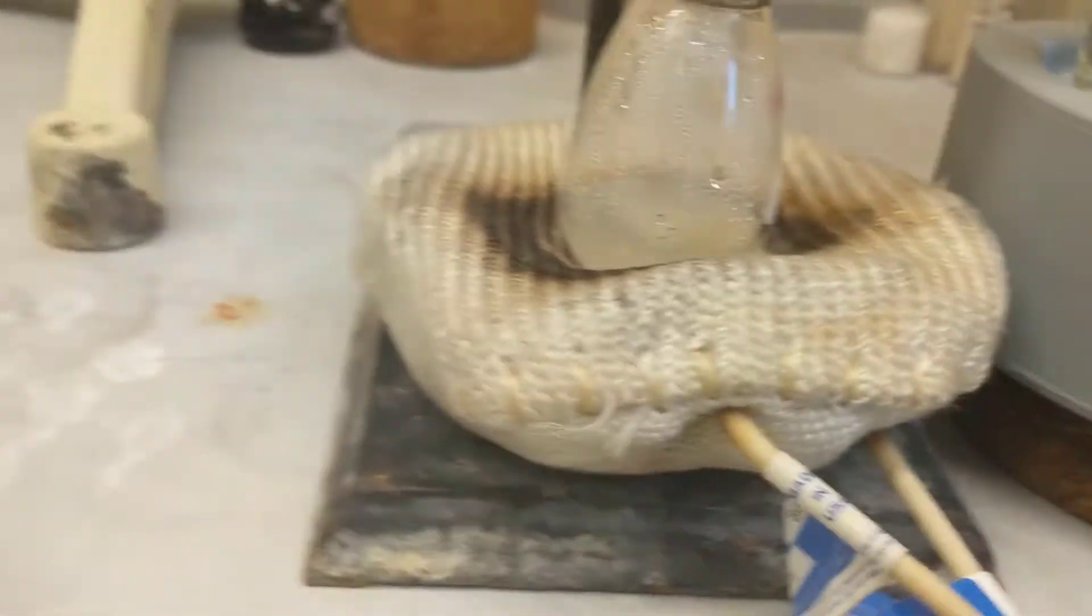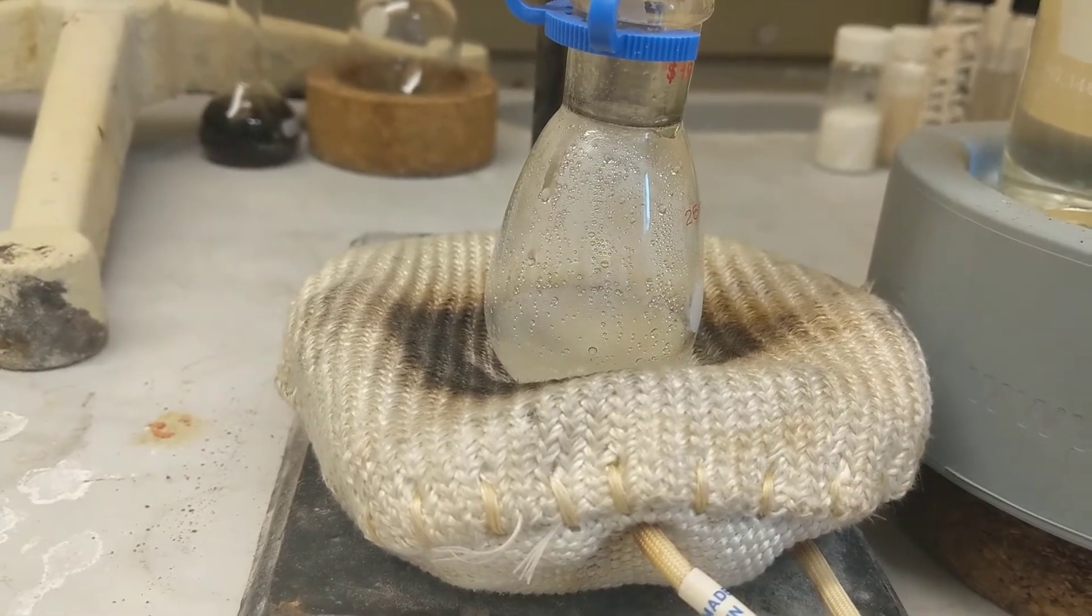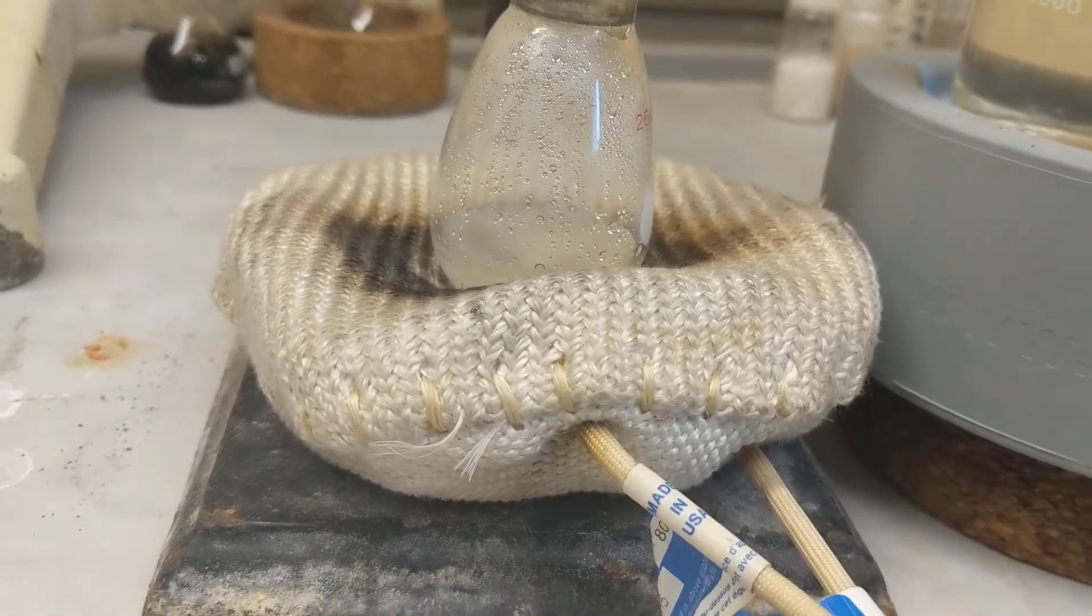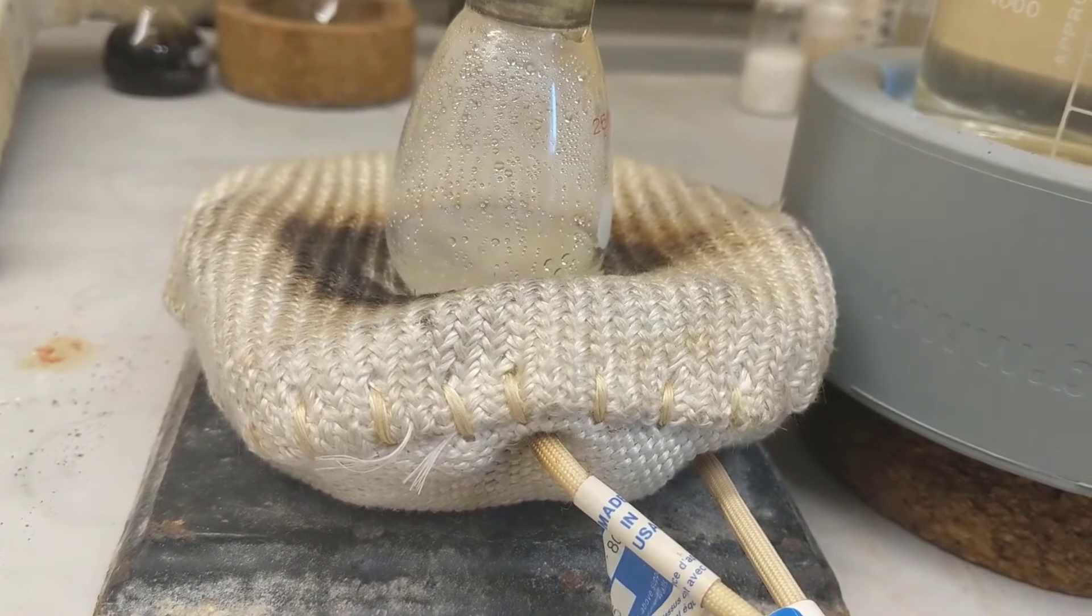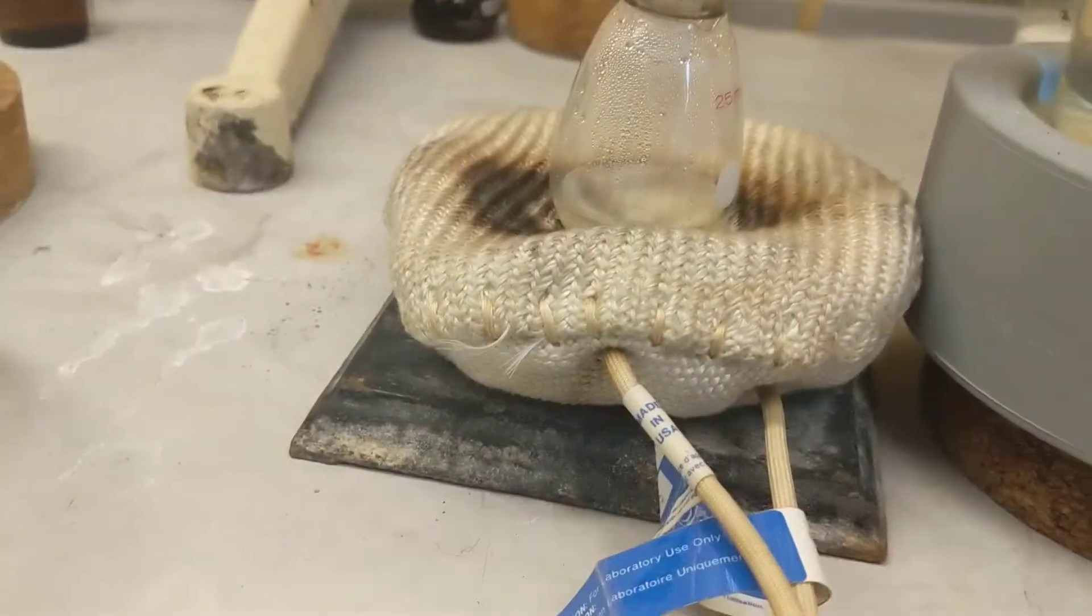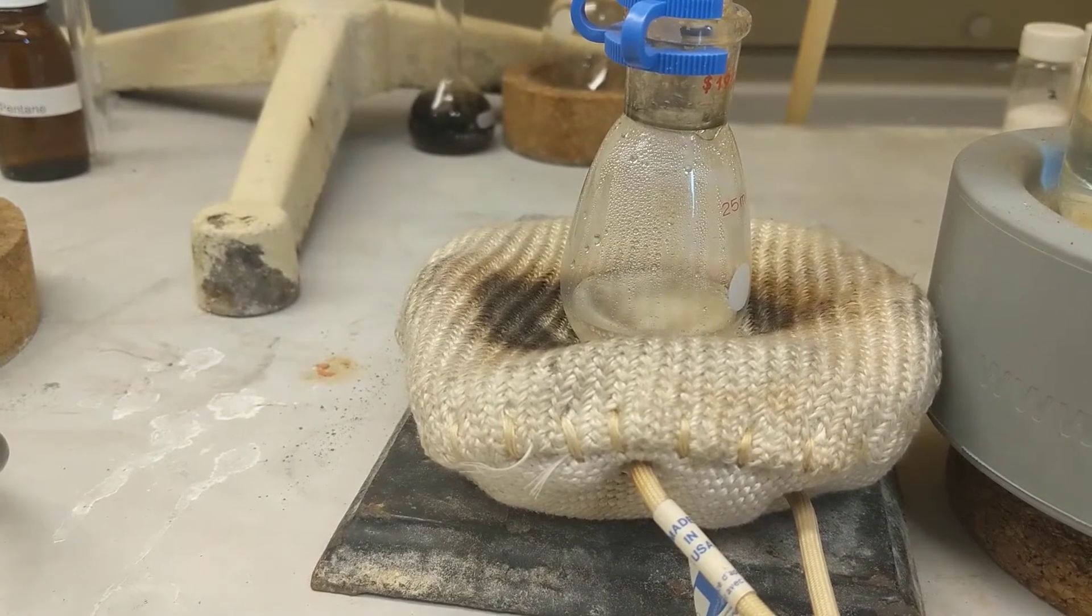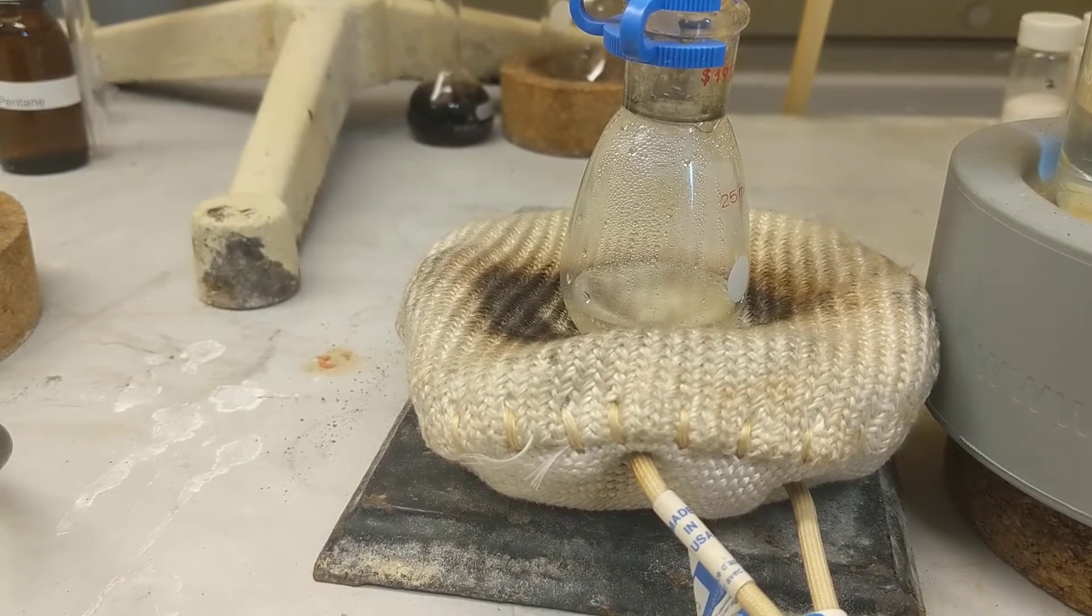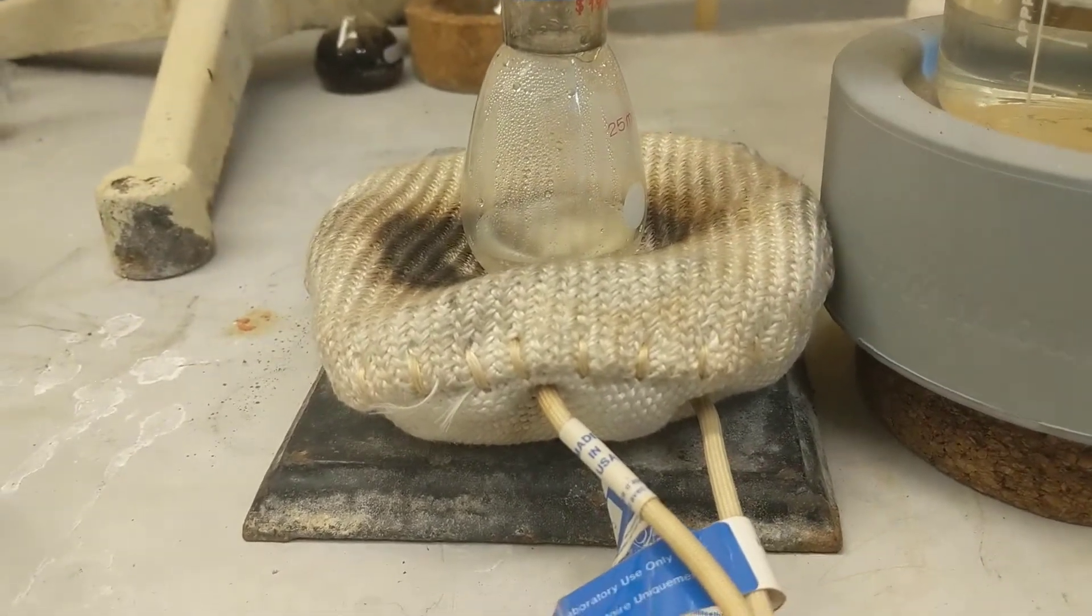We're back. I think you can see it's at a gentle bubble. I'm getting about one drop every two seconds, but that can quickly turn, so I'm about to start my timer. This is for Experiment 20A. Here's a check-in. You can see the drops a little better now: one, two, three, four, five. So we're getting about one drop per second, maybe a little slow.